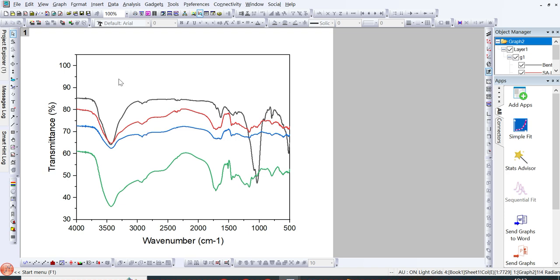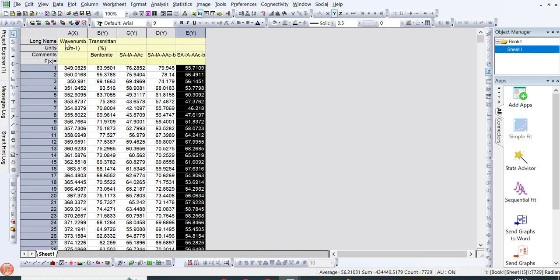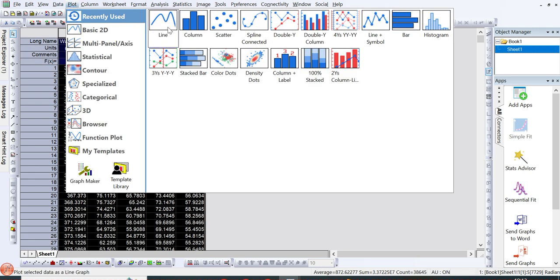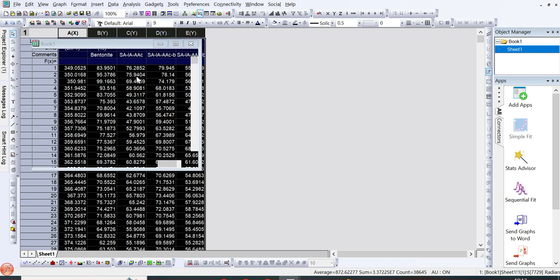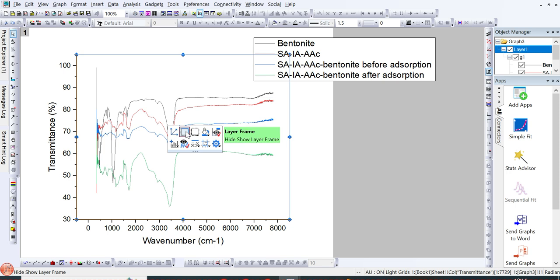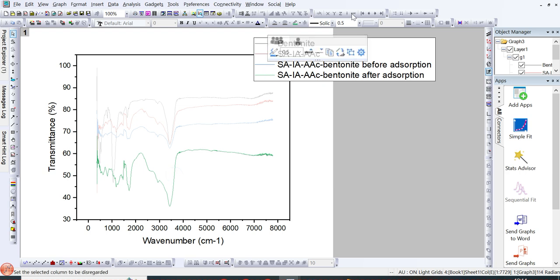So for example, this is the graph that I have. I have this kind of data, and if I want to plot a graph for this, I can go to line, and we have already discussed plotting FTIR spectra or other kinds of graphs in Origin, and we have discussed formatting issues in previous videos. You can check from that.